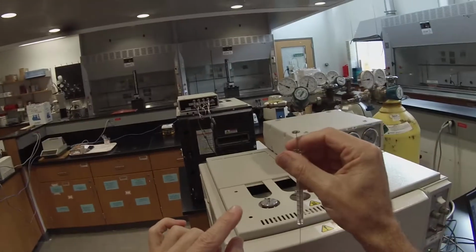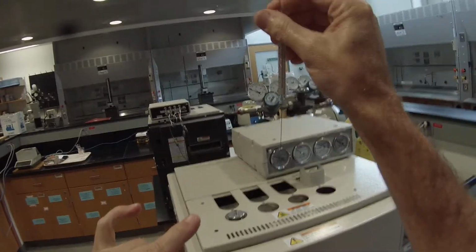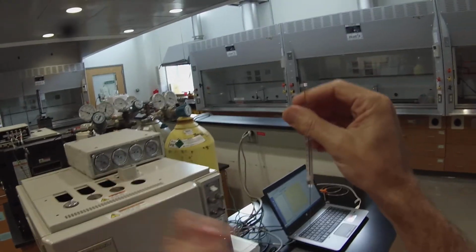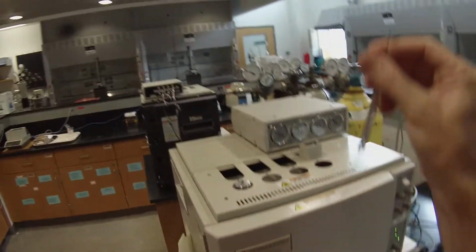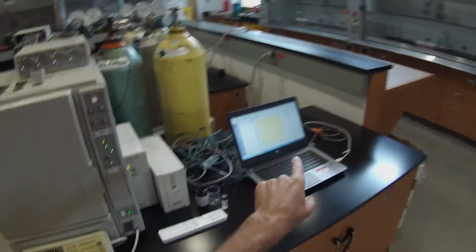So I need to put that in there, press the plunger, pull the syringe out very quickly, because as soon as I put it in there, it's going to start evaporating some of the liquid off the tip, and I don't want to get some evaporated and then put the rest in. That's called a double injection, and that will lead to overlapping peaks. As soon as I've injected it, I'm going to hit this start button on the keypad here, which will tell the instrument I started, and will change this from ready standby to acquire.